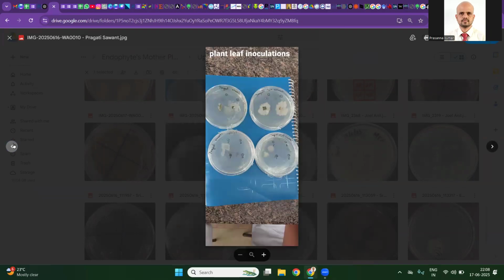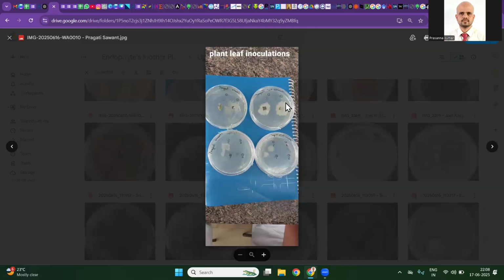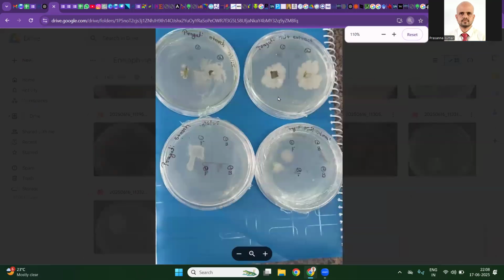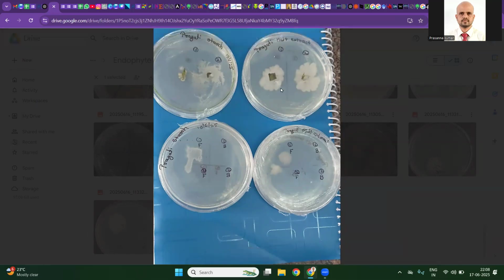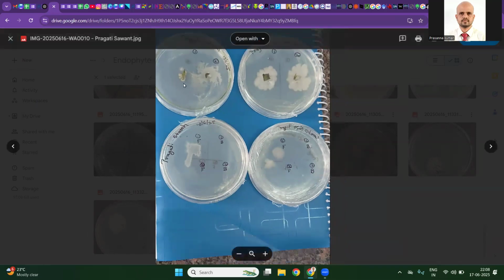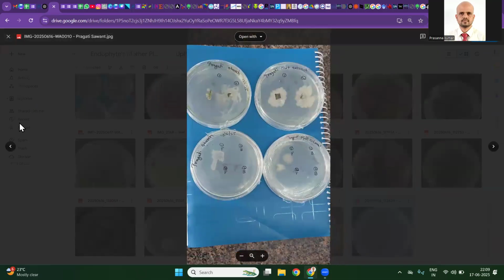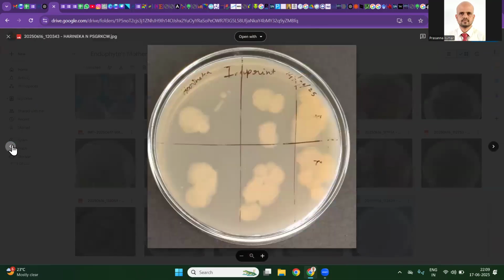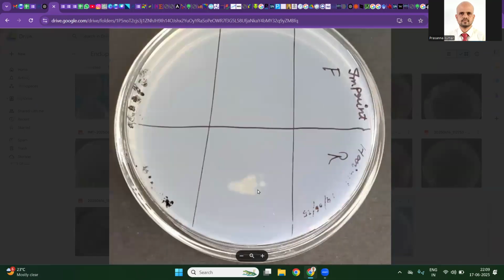Again, this has both imprint and inoculated plates. This is an inoculated plate. I would suggest you better use a black backdrop, not blue or something like this. But still the imprint has growth here. So whatever is growing here, we cannot confidently call them endophytes. Make sure imprints do not have any growth. Again, the imprint has growth here, and in this region the imprint has growth.